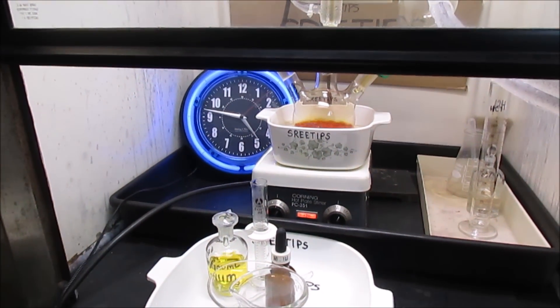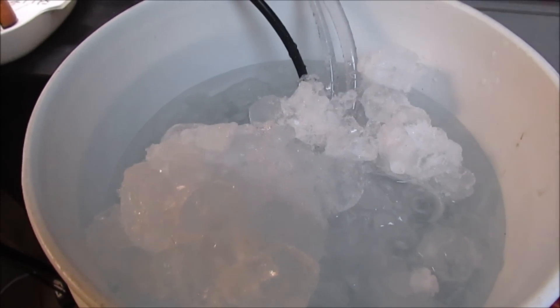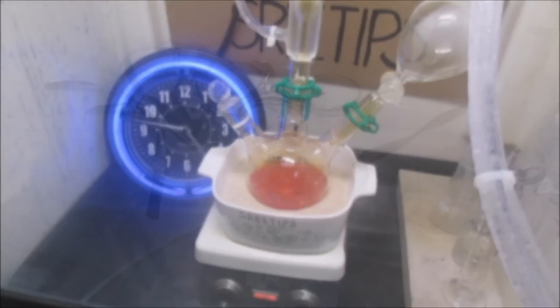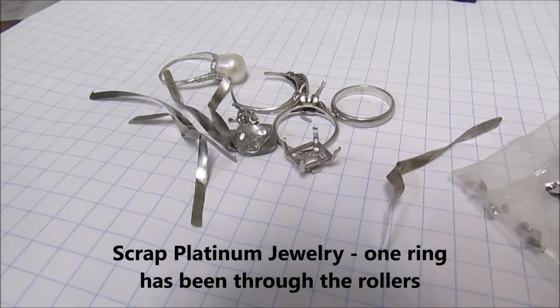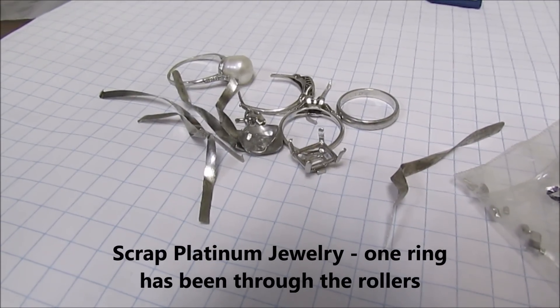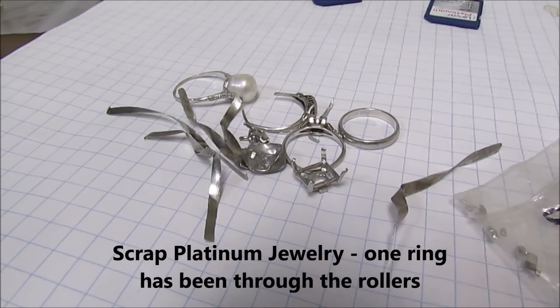We're just under 5 hours into the reaction and I went out and bought another bag of ice to replenish my cooling tower. I'm going to let this continue to cook until I'm quite certain that all the platinum has gone into solution. Here are some small pieces of platinum I've been saving until after I gained some experience — I'm going to try to refine these later. They'll have some other platinum group metals in them, probably some iridium and rhodium. We'll try to do a hydrolysis on that to get some pure platinum out — that will be in another video.